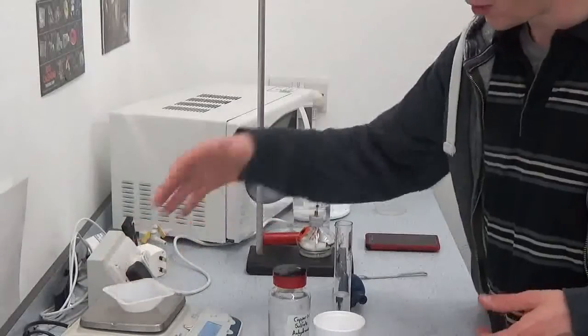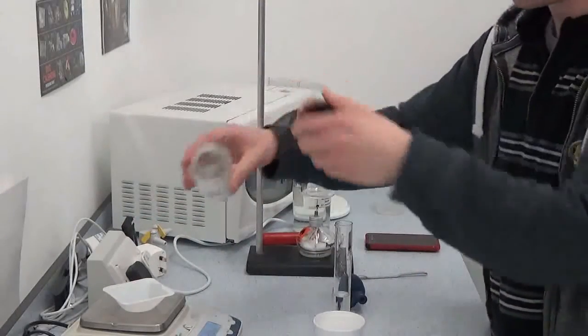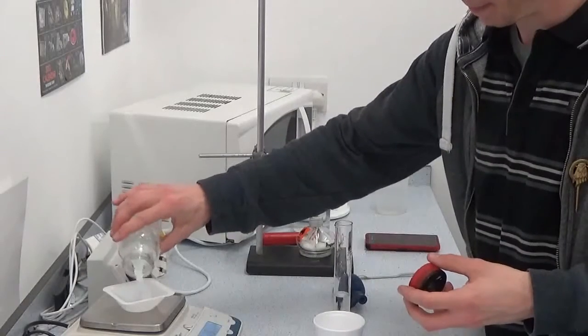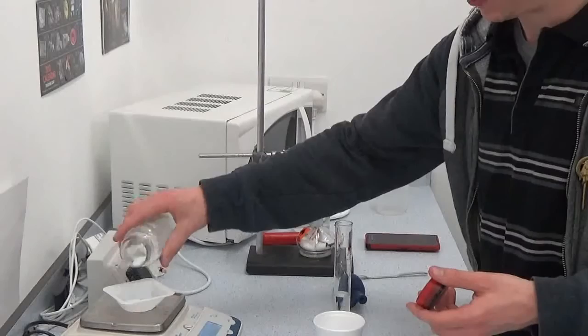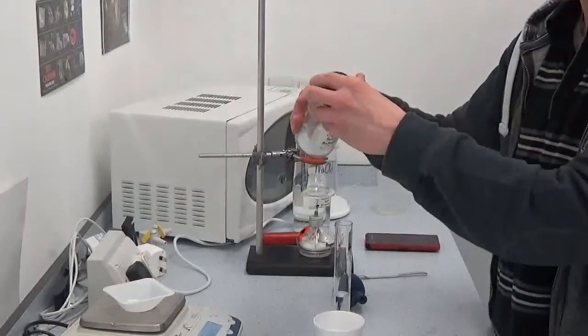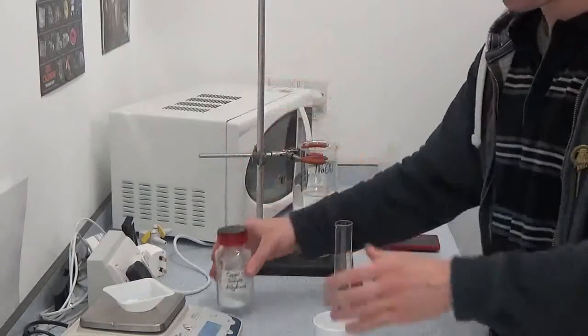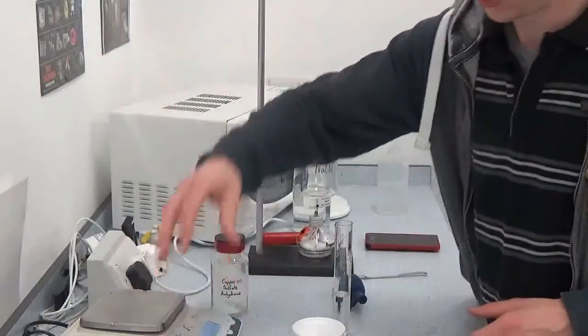So going through it, simple thing to do, obviously record the mass of the boat and the solid. You're asked to weigh out four grams if I remember right for this, so there's about four grams there and we're going to put that to one side.